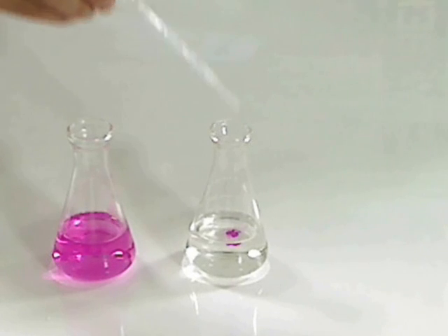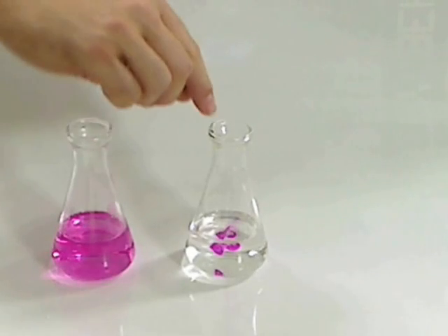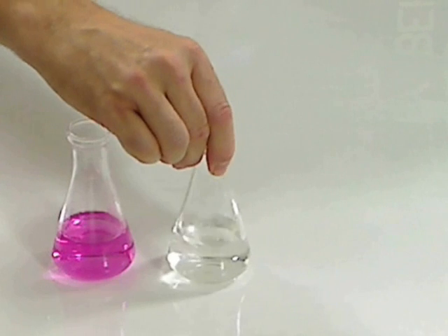Adding a base, you'll see right away the very vibrant pink, but when I swirl it, the pink does go away.